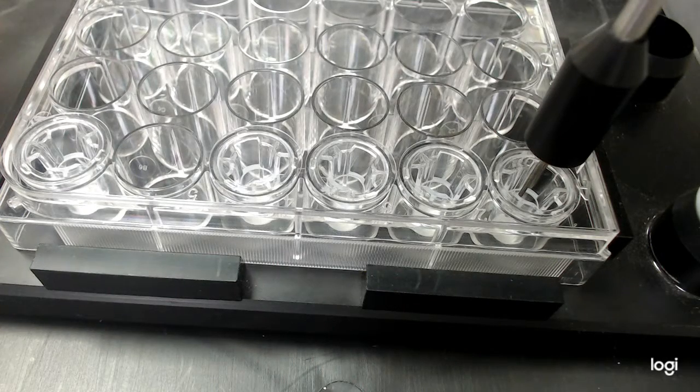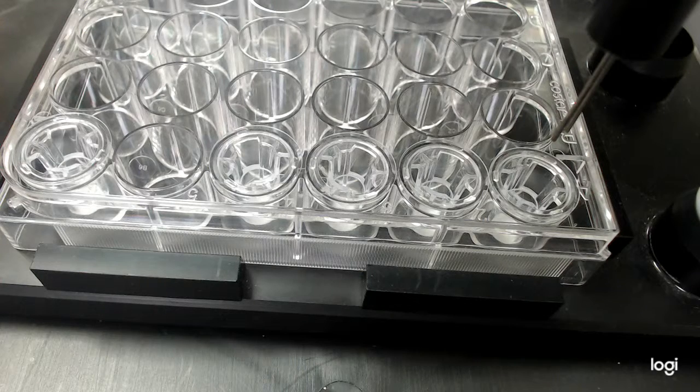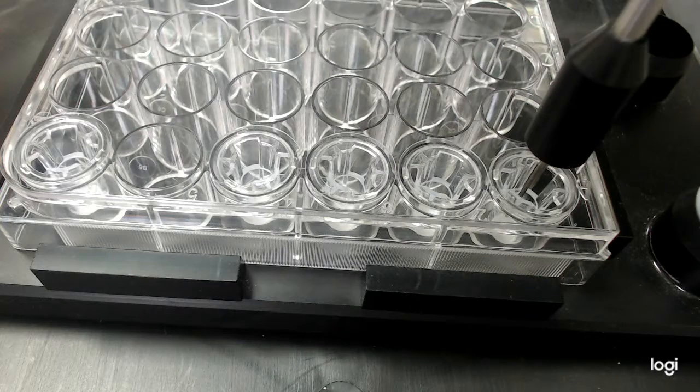I'm going to run the REMS system right now. Let me show you. It will take a minute since I'm changing the settings in the software. I'm going to go down into this well again so you can have a better look. This is the electrode I'm talking about, and it's going to go to the Z low position, inside the well. As you see, since this insert moves, that moved the system a little bit.